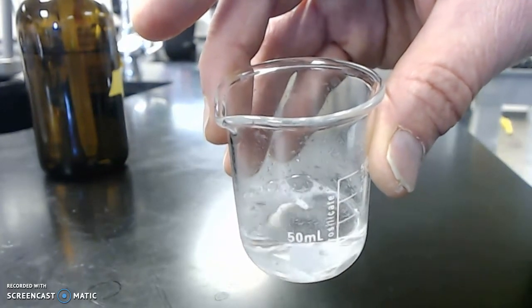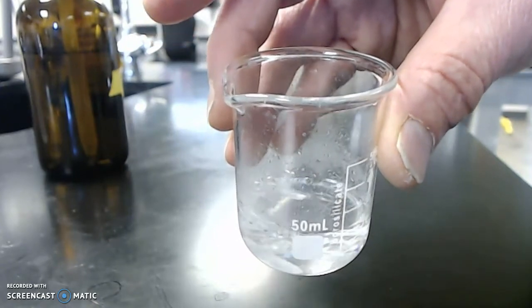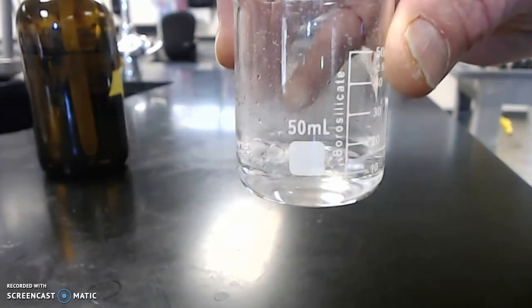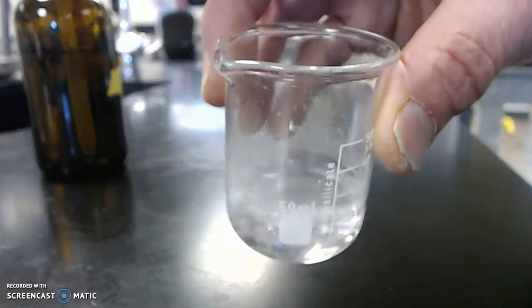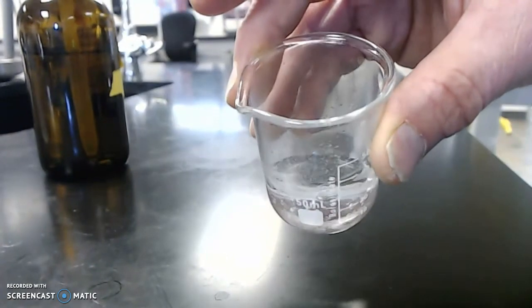If you are carefully observing, you can see some vapors leaving the top of the beaker. So it looks like some gas is being produced. Well, yeah, there has to be gas being produced because there's all sorts of bubbling happening around the magnesium strip. Let's see if I can turn it like this without spilling. Nope, that's not going to help.